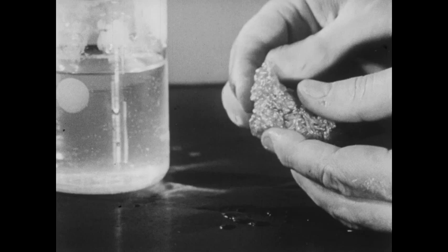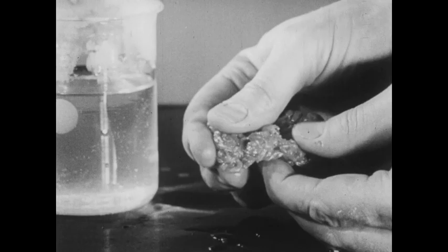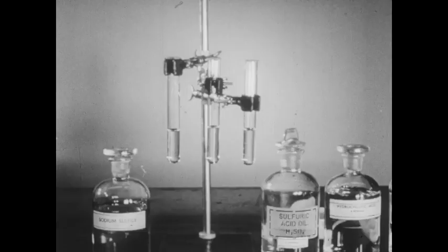This transition takes some time, however, and won't be complete for quite a number of days at least. In the meantime, the sulfur will slowly lose the rubbery properties that it has now and will become more and more brittle.